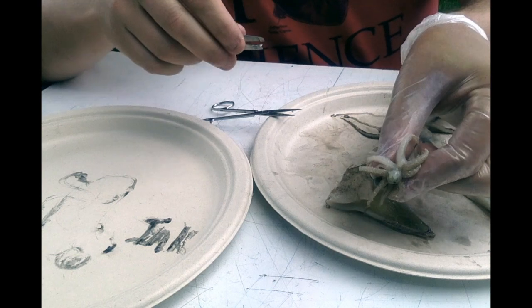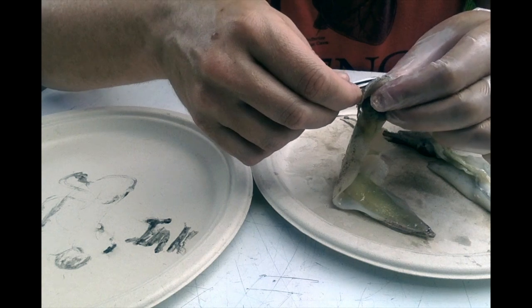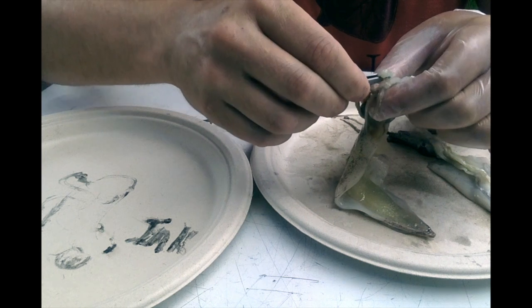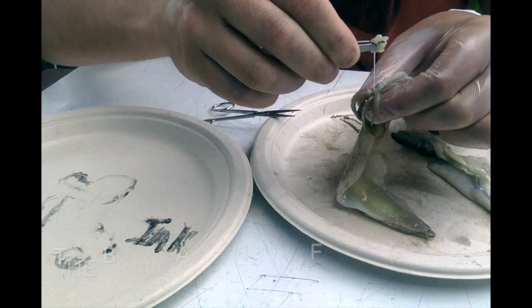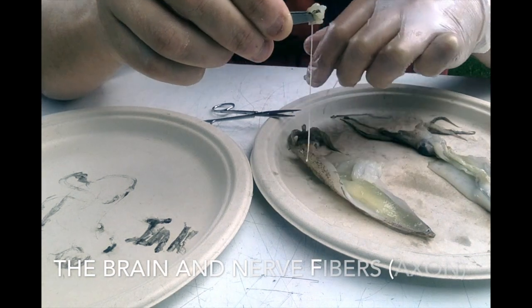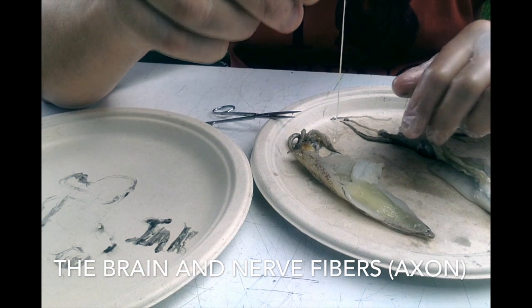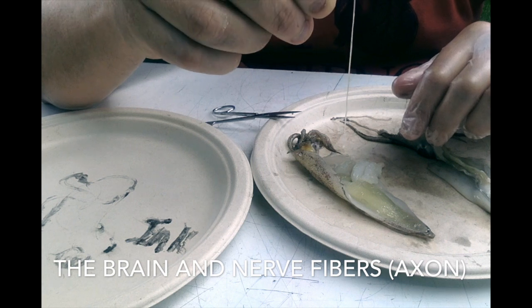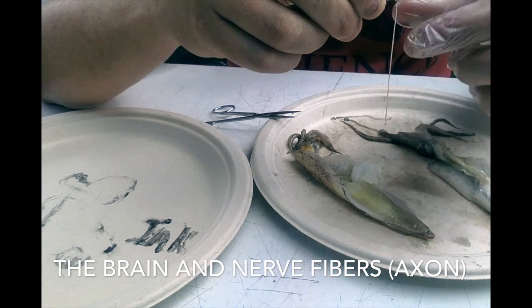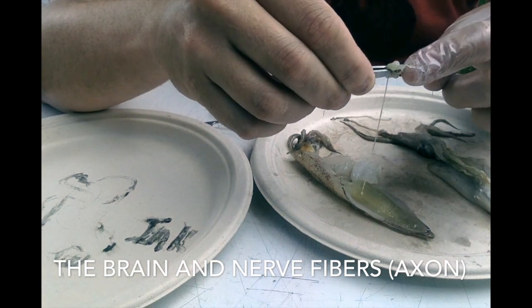Okay. And what we're looking at right here, what was connected to the beak, was the mouth. And then if we go in a little deeper, we pull this out. This doesn't always work perfectly. But if I pull, not too hard, you can see that long string. That is one of the longest axons in the animal kingdom. And an axon is the long tail of a nerve cell. So this is this huge network of nerve running from the brain. This is the squid's brain.